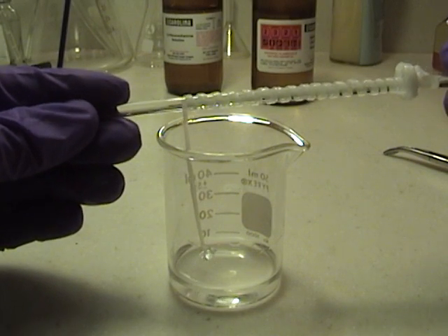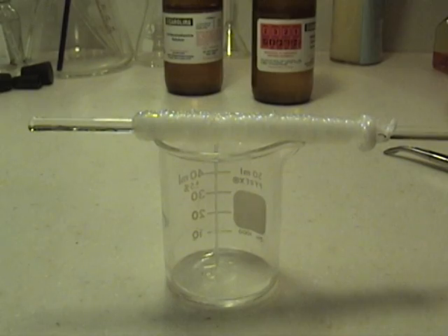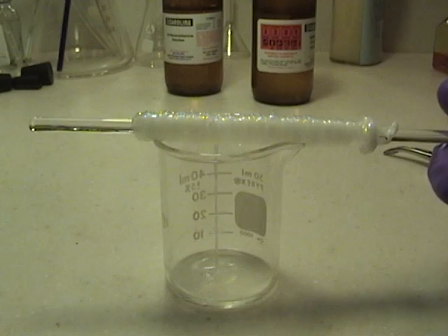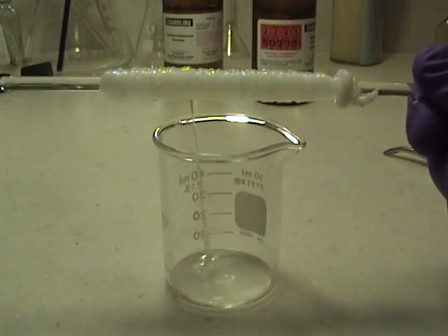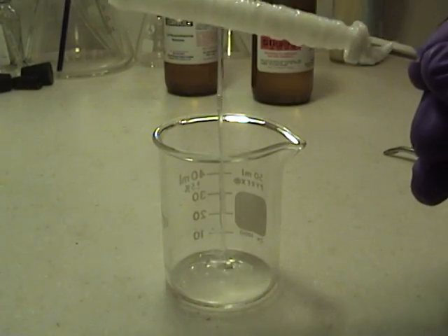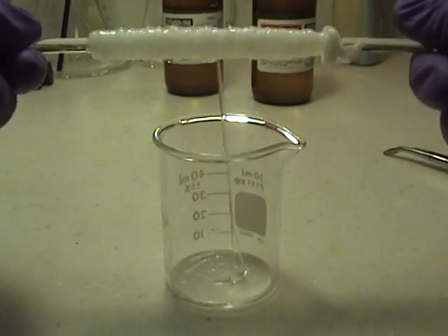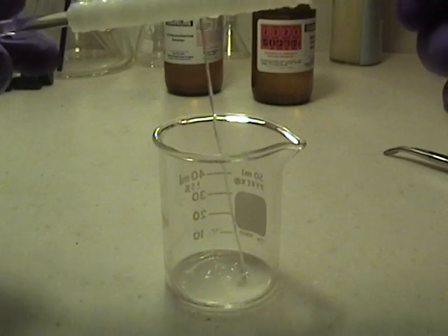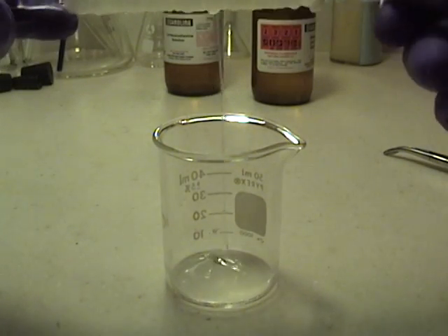You can see there is a nice coil on there. Now after about four to five minutes of winding, as you can see I have gotten a lot of nylon. It is getting near to the end, and you can tell that by seeing that the strands have become a lot smaller.